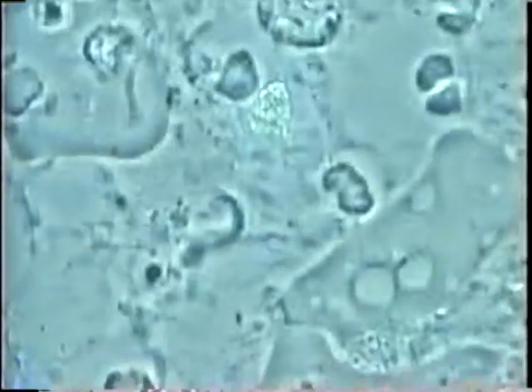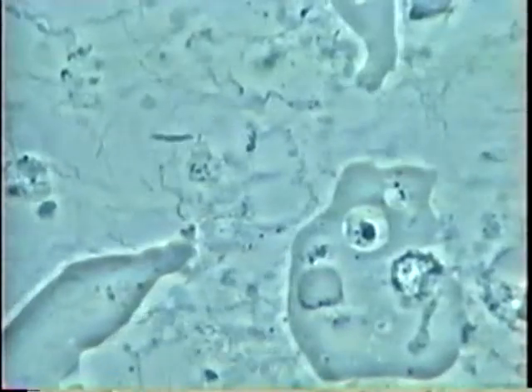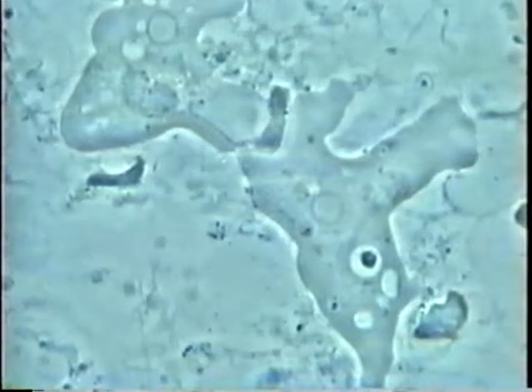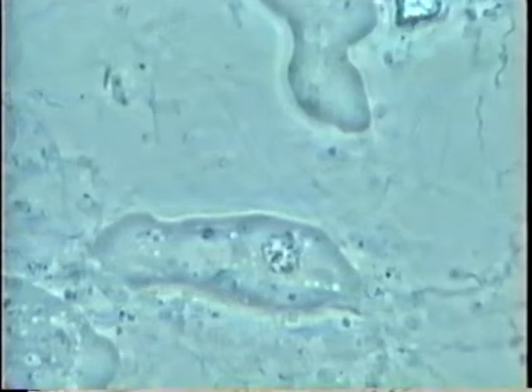It is very impressive to see this activity in gum disease. If you want to cure the disease, you have to get rid of all this, because it is not compatible with health. We see amoeba in full activity, phagocytosis of the nucleus by the upper amoeba — they are moving along with the bacteria. Sometimes you see the uroid at the end of the amoeba, with many cells inside, showing active phagocytosis.